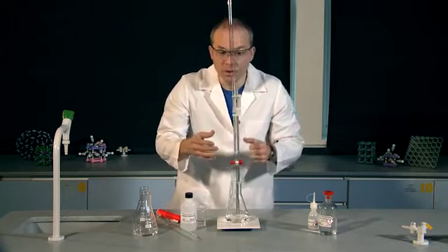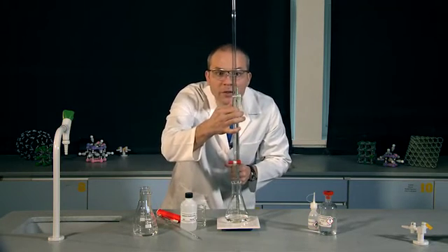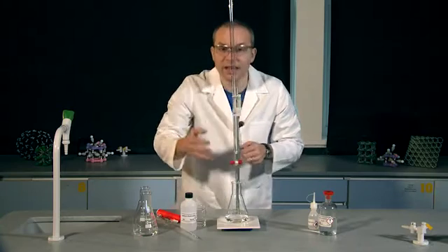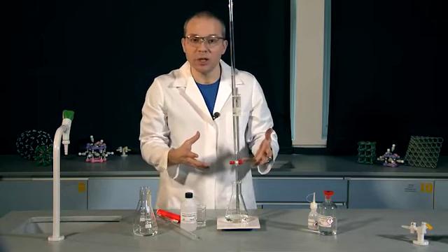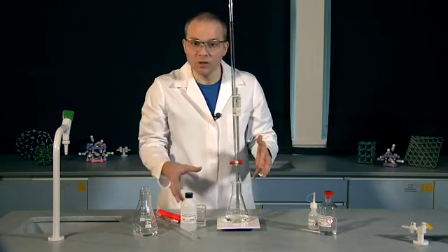I need to measure that volume. Looking at the base of the meniscus, I've got 28.6 centimetres cubed. So I've added 28.6 centimetres cubed of hydrochloric acid to neutralise my alkali.